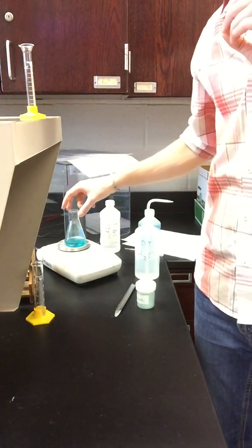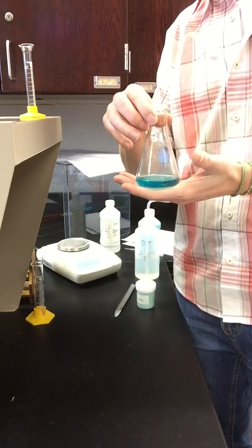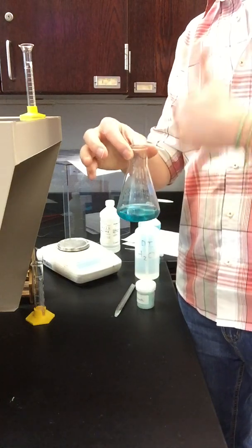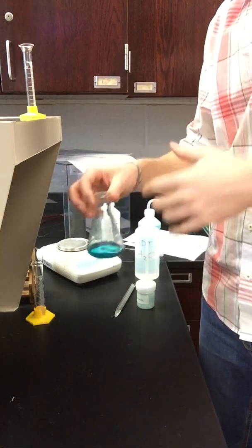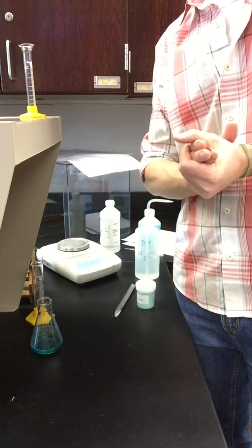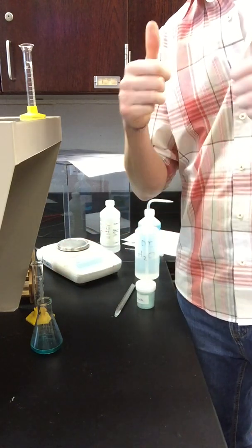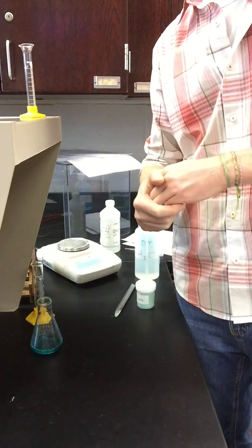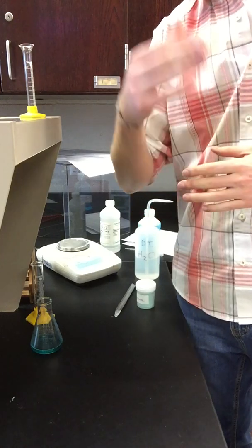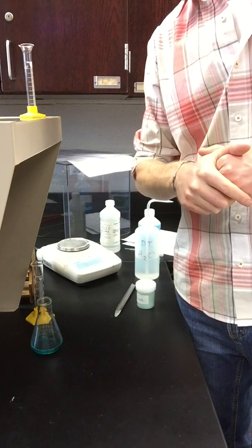If you look at the mass of the flask plus the unknown plus the acid, and you subtract the mass I just gave you, that is the mass of carbon dioxide that's gone away. That carbon dioxide difference will tell us the mass of carbon dioxide that we've given off, and that will afterwards allow us to calculate the percentage of carbon dioxide that was initially in our unknown. So this is all of the data for the lab. There are quite a few calculations that need to be completed, but you now have all of the data necessary to go forth moving forward with those calculations.